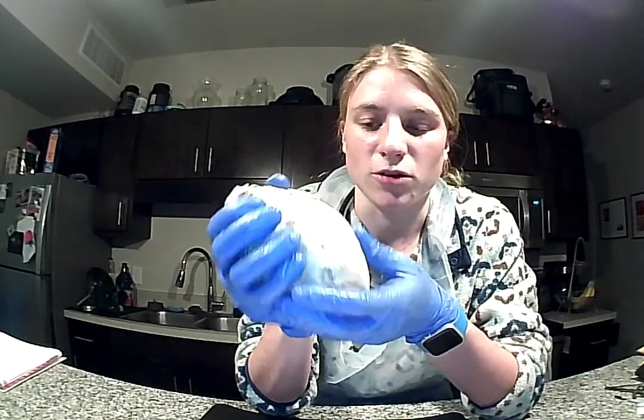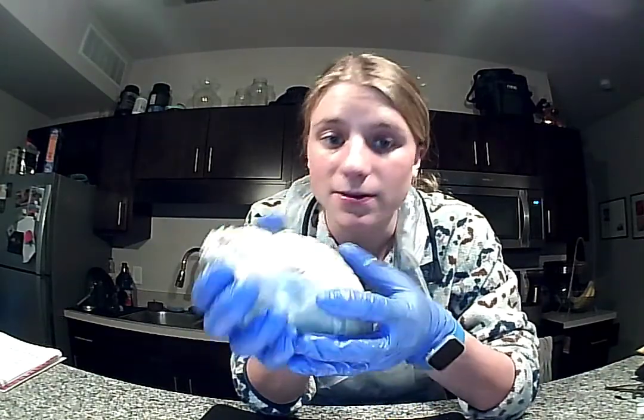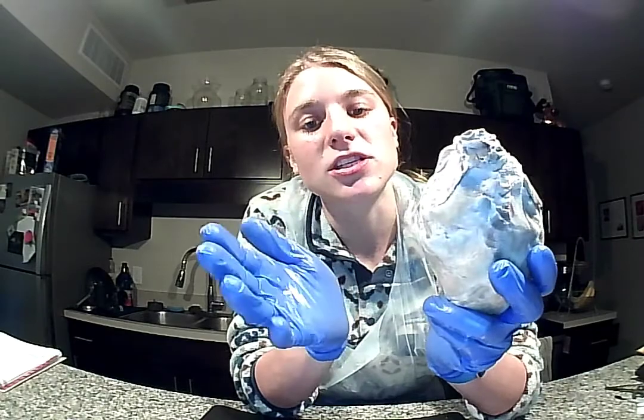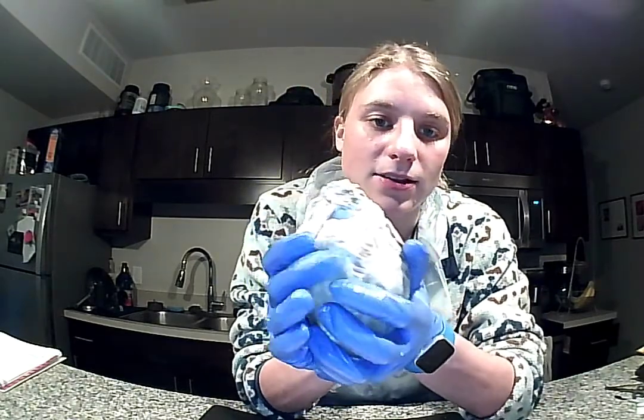The first superficial feature is going to be the epicardium, which is also known as the visceral layer of the serous pericardium. And that is just going to be what surrounds the entire heart. So that's just going to be that layer that surrounds the entire heart.